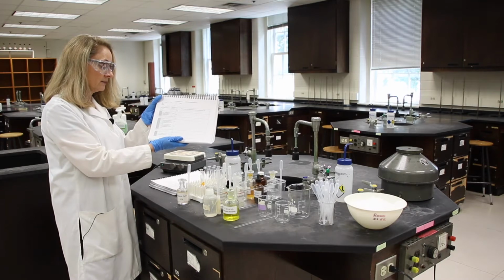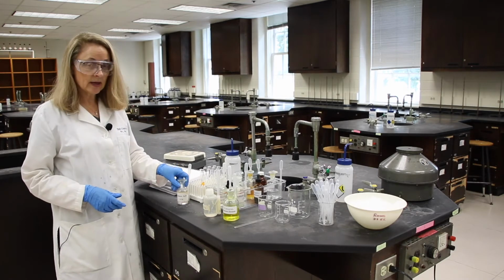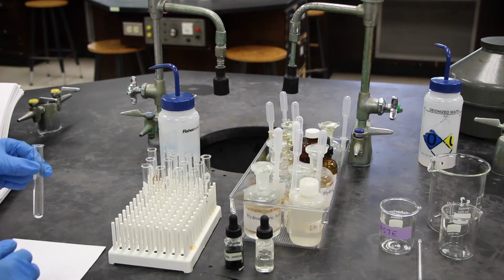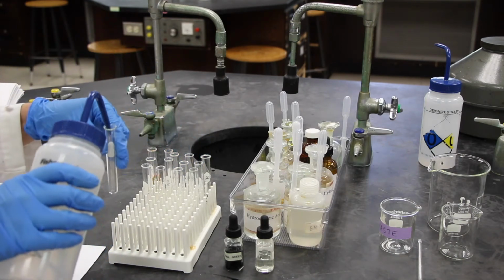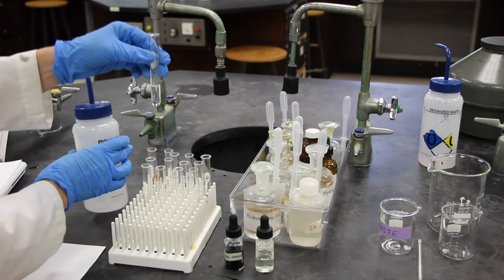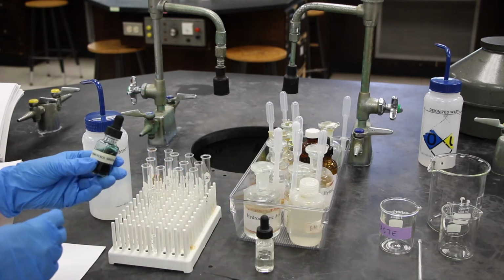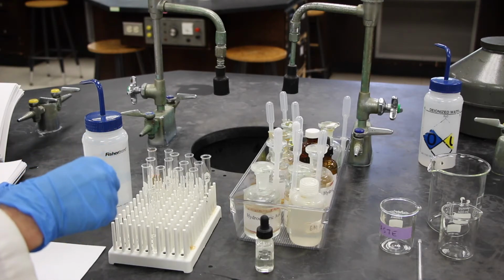What ion caused the shift in equilibrium in this step? In part B, we'll look at the weak acid, weak base equilibrium. To a test tube, we're going to add about 3 milliliters. Again, that's about an inch. The amount is not terribly important, of DI water to a test tube. And then we're going to add 1 drop of the bromocresol indicator solution, bromocresol green.